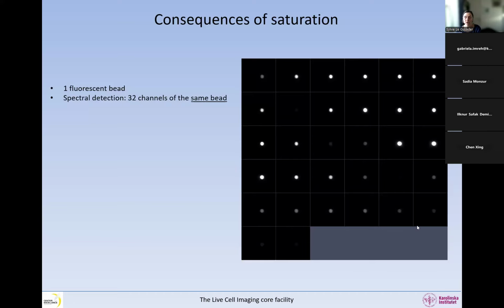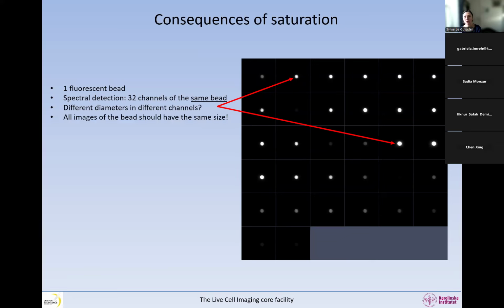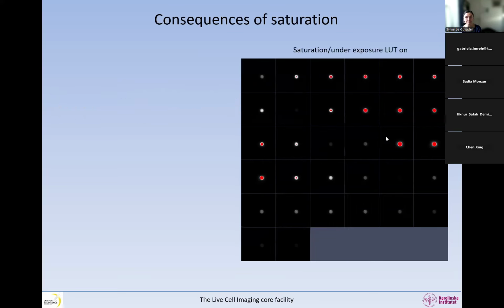So we have 32 images, each of them representing 10 nanometers of the spectrum, 32 images of the same bead. So we have only one bead, okay? And we have 32 images in different colors of the same bead. But something is a bit bizarre, because in some images the bead has a certain diameter, in other images the bead looks bigger. So there's a different diameter in the different channels. How can that be? We have only one bead, so they all should have the same size.